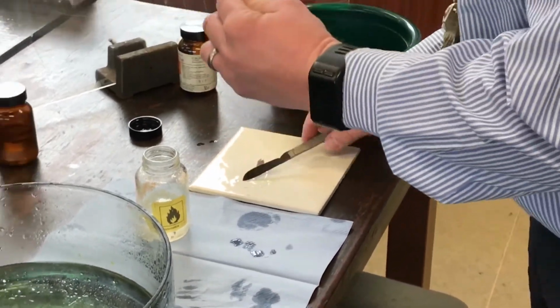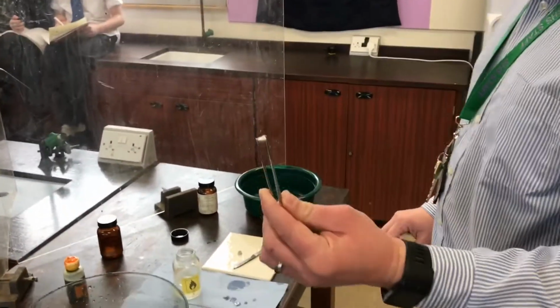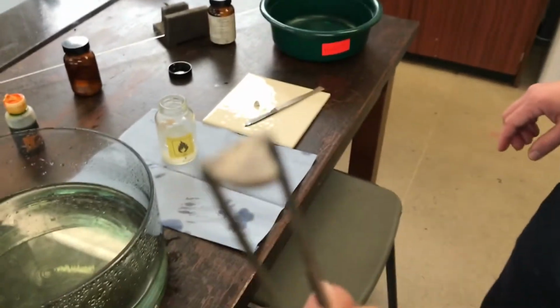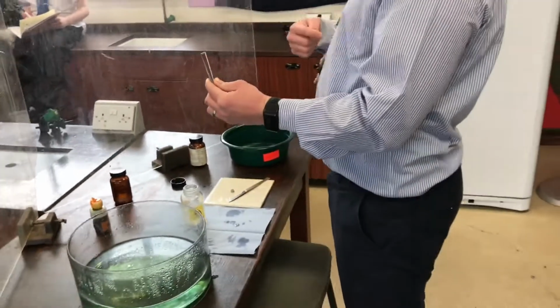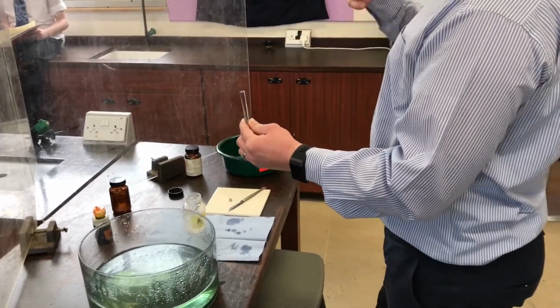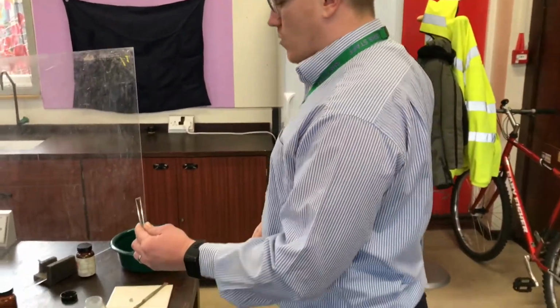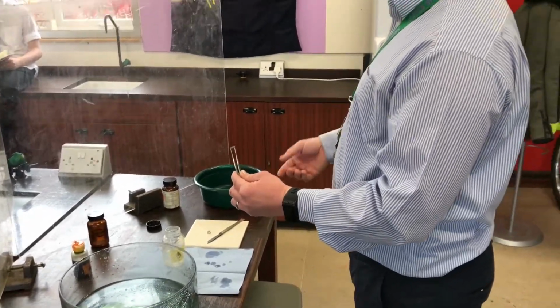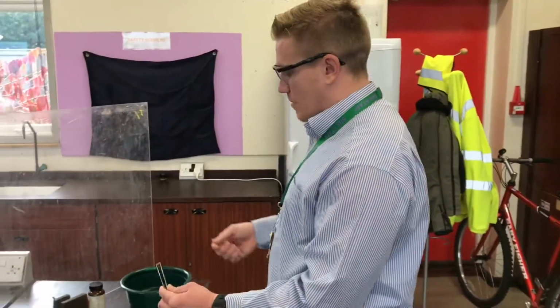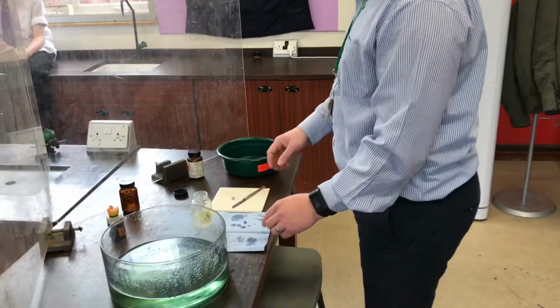Shiny. Yep. Okay, not as shiny, I don't believe, as the lithium, but that is a piece of qualitative data. That's me making an assumption about something, not quantitative. Quantitative is a number, isn't it? And you wanted a number about pH. We can't give that. We haven't got an indicator strip to give a number, but we have got what we believe it looks like.